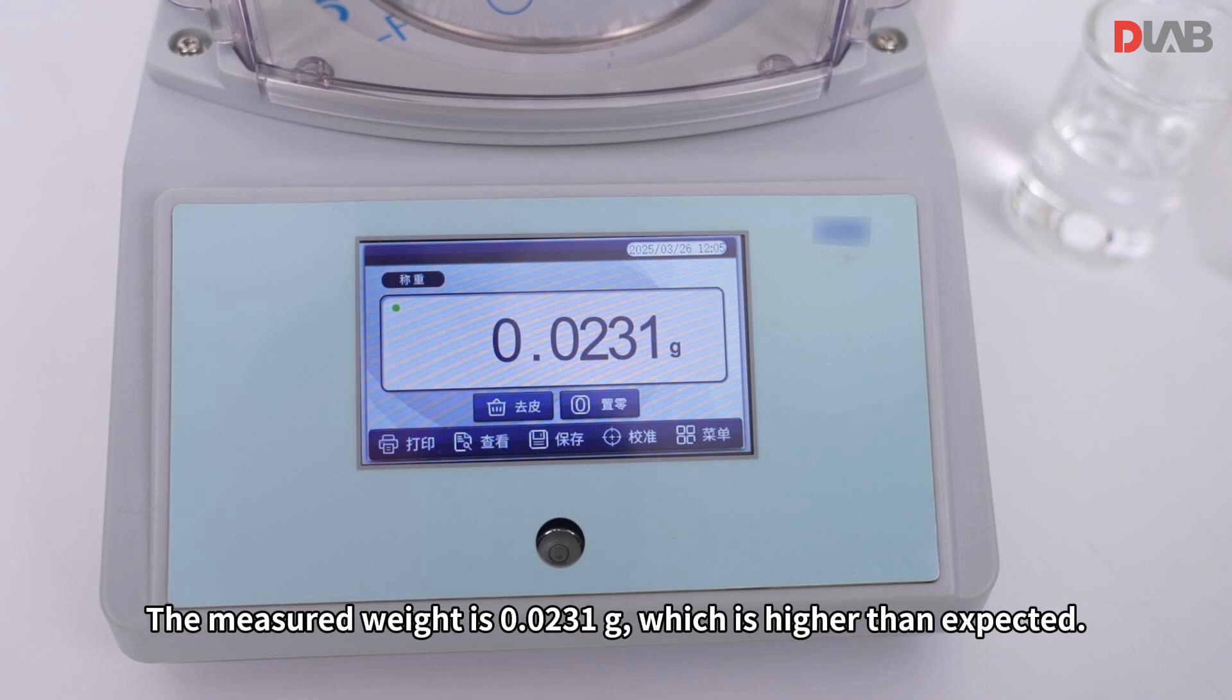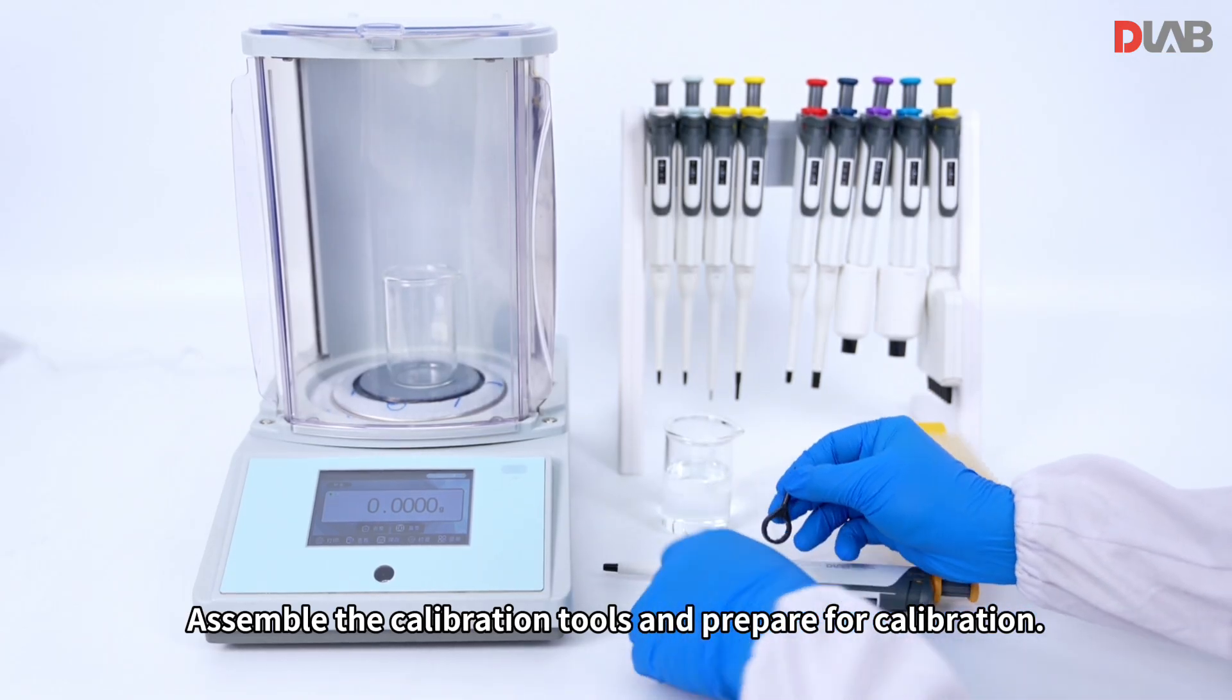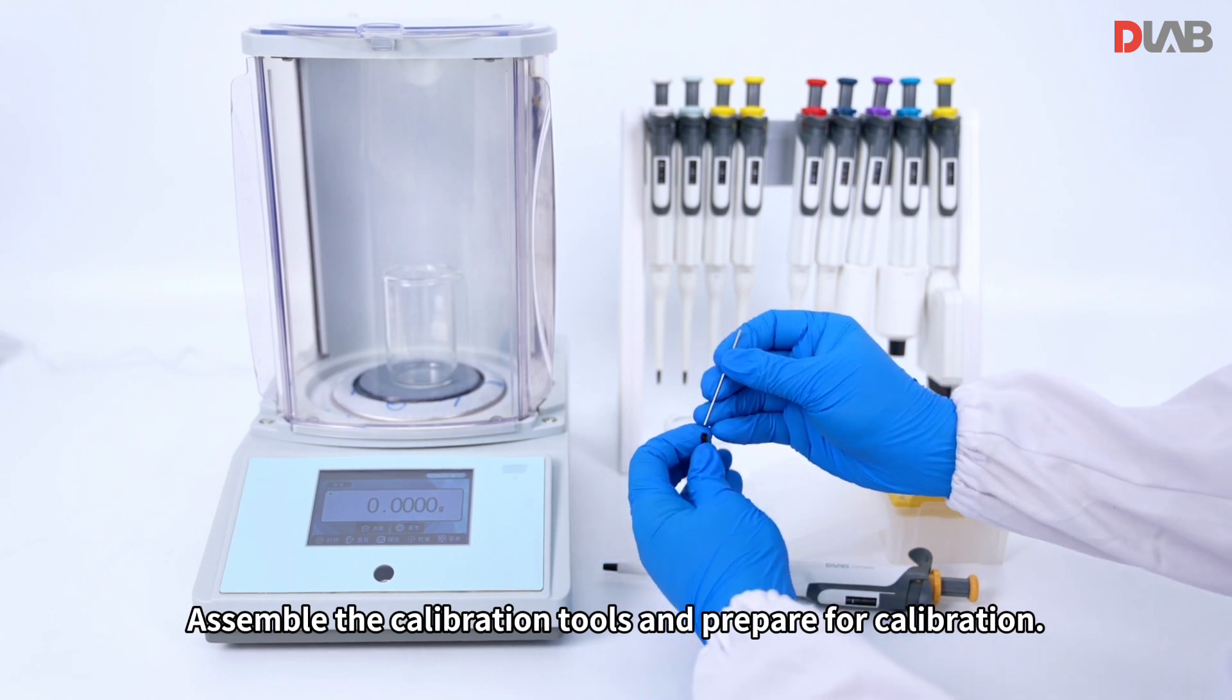The measured weight is 0.0231 g, which is higher than expected. Assemble the calibration tools and prepare for calibration.